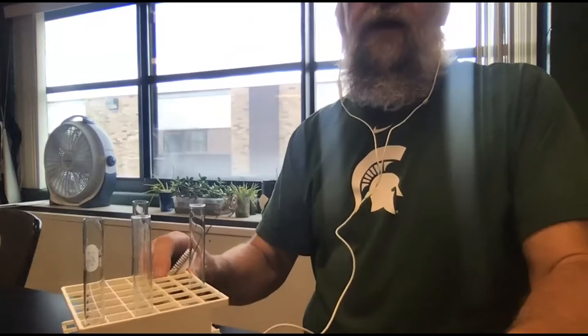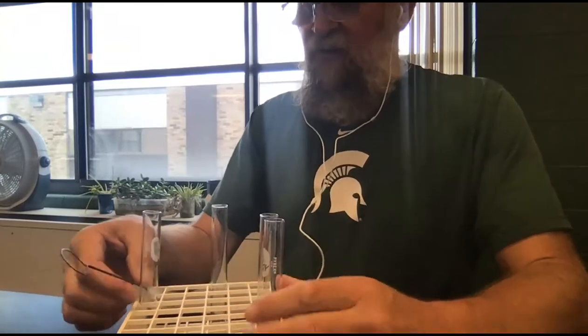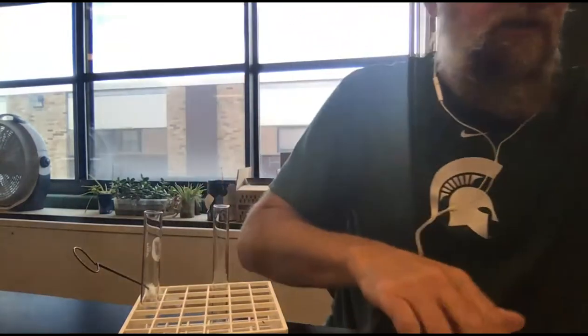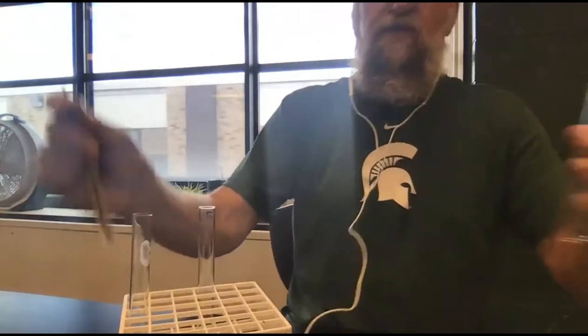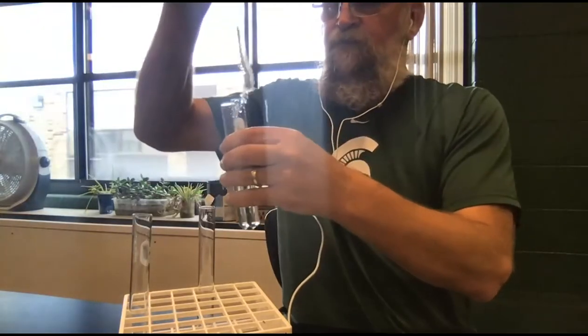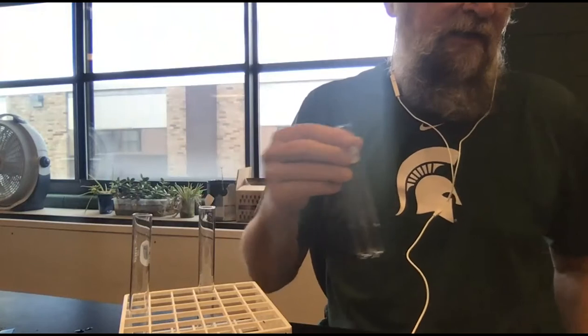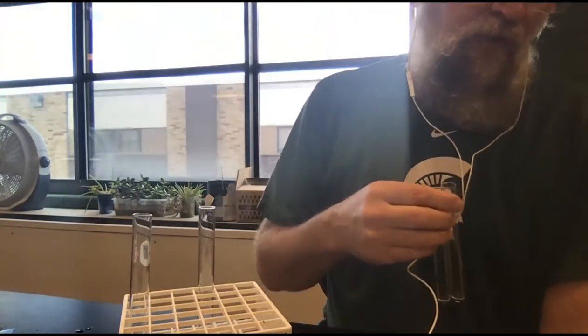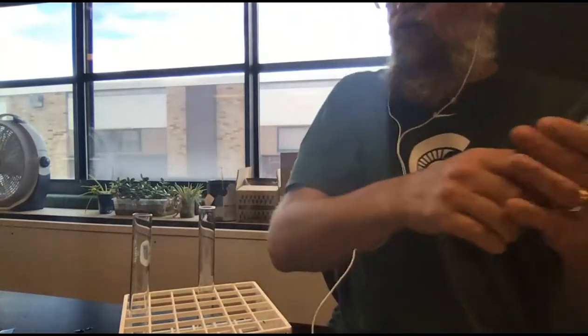So in station 4, everything's backwards on the camera, so I've got to make sure I'm doing this right. I've got a set of test tubes. I'm going to put some water in and clean these out. I'm taking my brush and cleaning them out. Okay. And then I'm supposed to add a pinch of salt in one, and a pinch of sugar in the other. I'm going to add 10 mils of water.